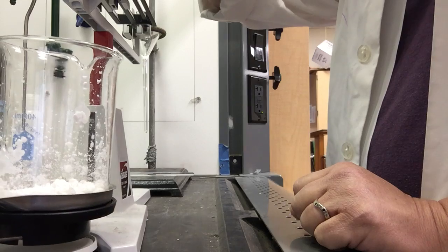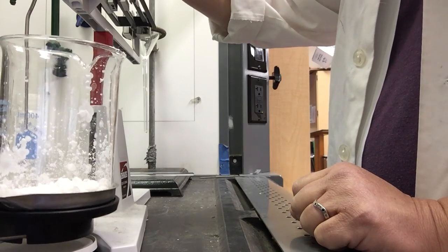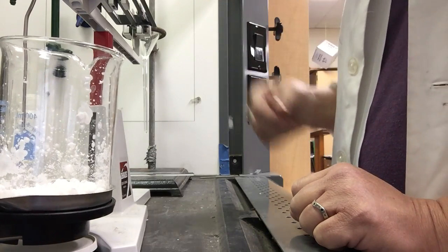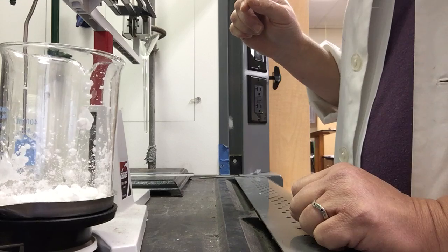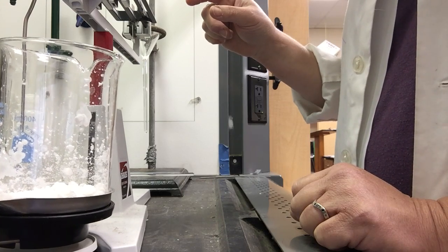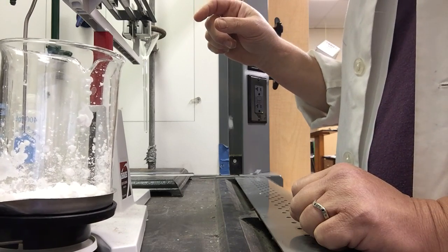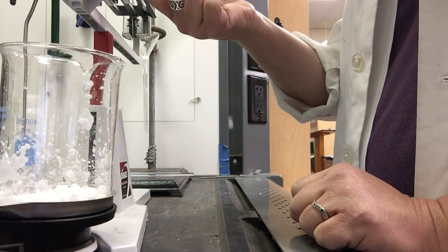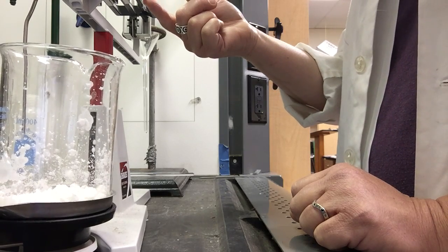So now I'm going to adjust my ones. I'll take it up to 9. Oh, still a little bit. Oh, we're getting very close to balancing here. All right. So I'm going to move this slider.